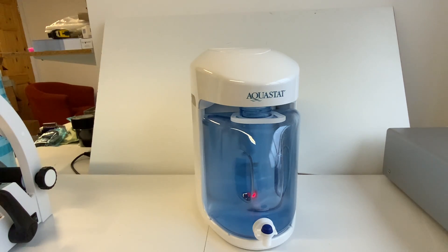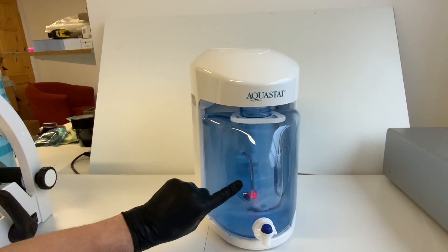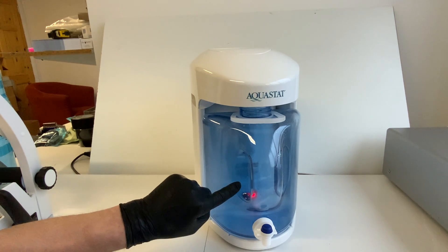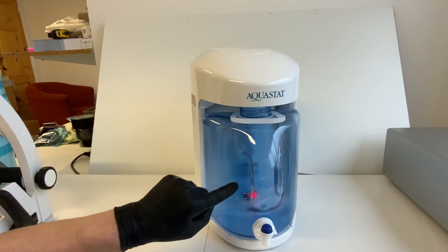This does take a little time to distill. Basically, the water will be turned to steam and the steam is gathered as distilled water in the jug. This can then be used in the autoclave for the sterilization process.